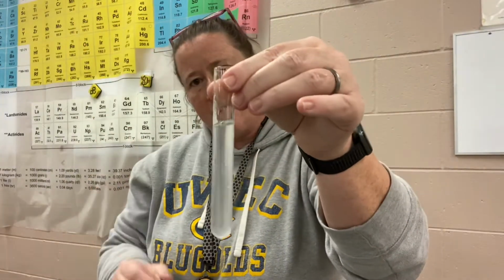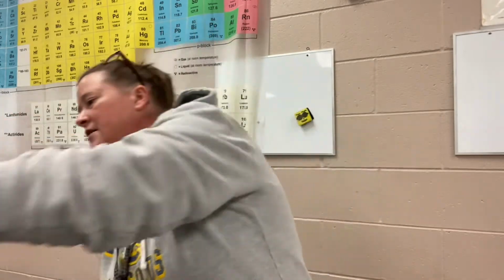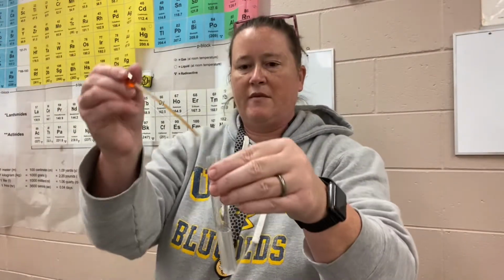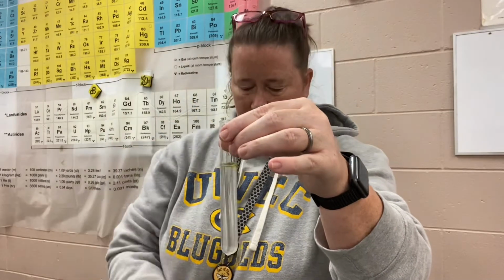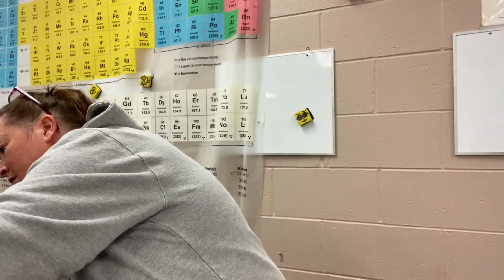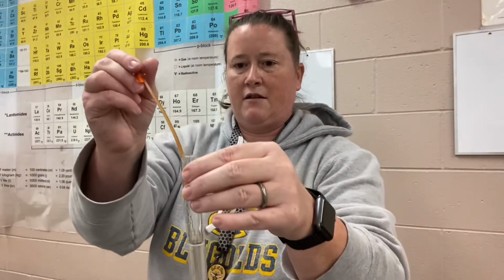So eventually we're gonna get to a point where I'm starting to see a little bit of a purplish color lingering. And these ingredients are not toxic. They are not toxic, which is why I was able to put my thumb on there. There is still vitamin C in there that's keeping the iodine from getting to the starch. And there is a lot. Which is really surprising to me. I was not expecting this.